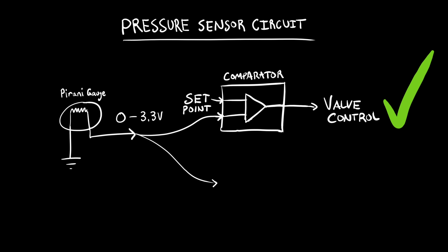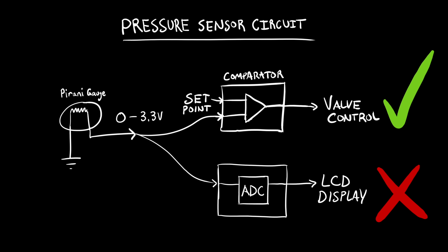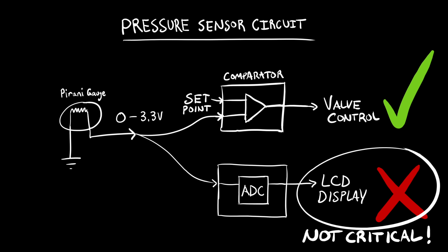All of that worked just fine, thankfully. Quite separately, however, the analog voltage feeds into an analog to digital converter so that it can be displayed on the LCD. That part of the circuit seems to be broken. I tried to fix it but was unsuccessful. Now, fortunately, this won't keep the machine from operating.